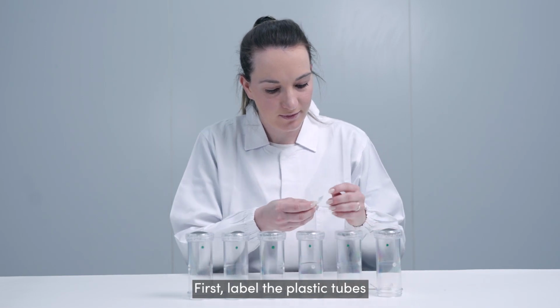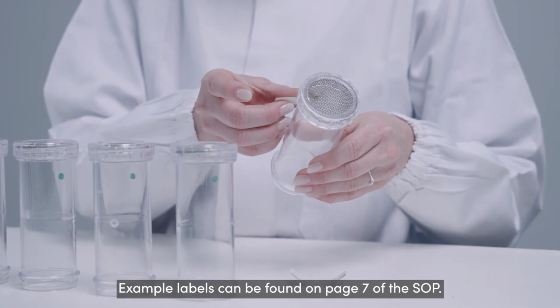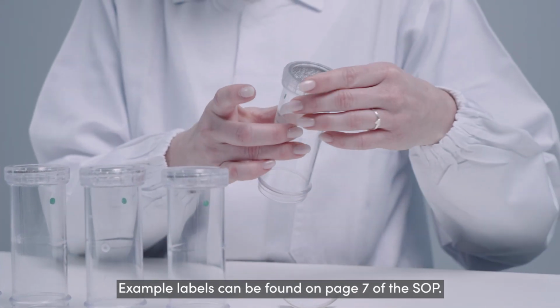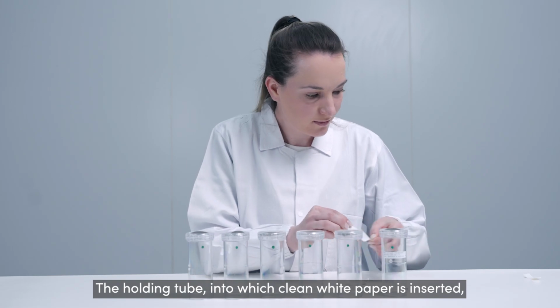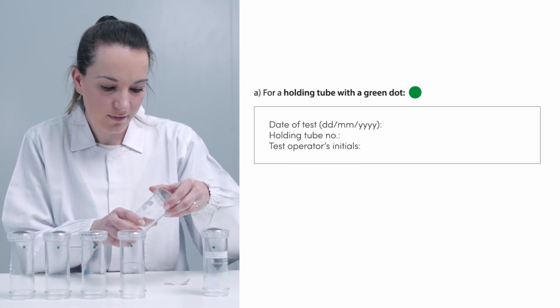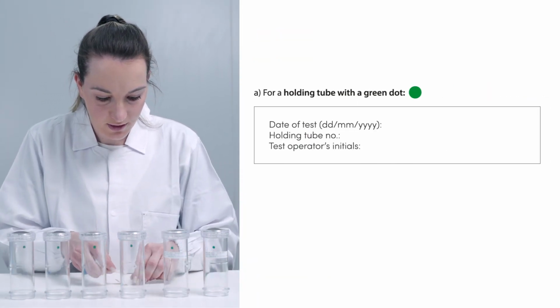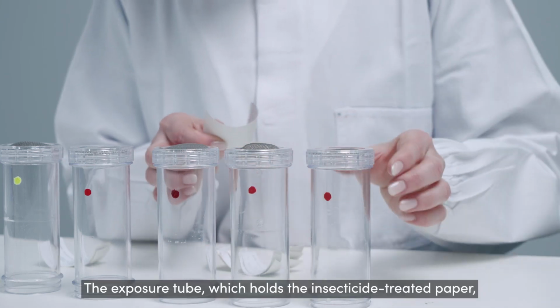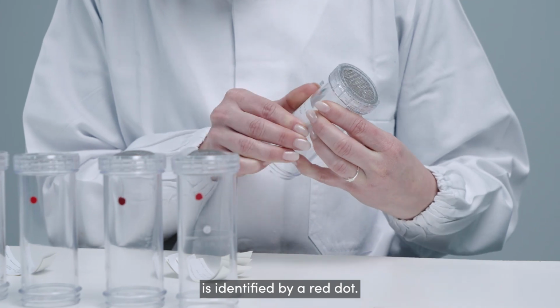First, label the plastic tubes in the WHO tube test kit. Example labels can be found on page 7 of the SOP. The holding tube into which clean white paper is inserted is identified by a green dot. Its label should include the date of the test and the holding tube number.